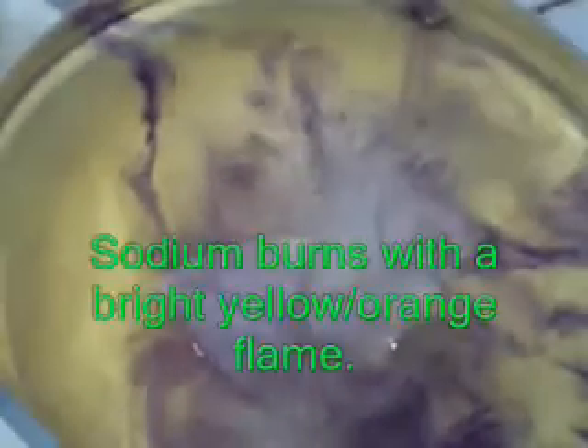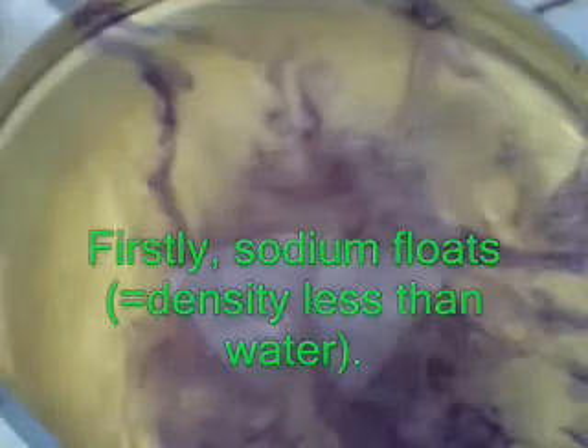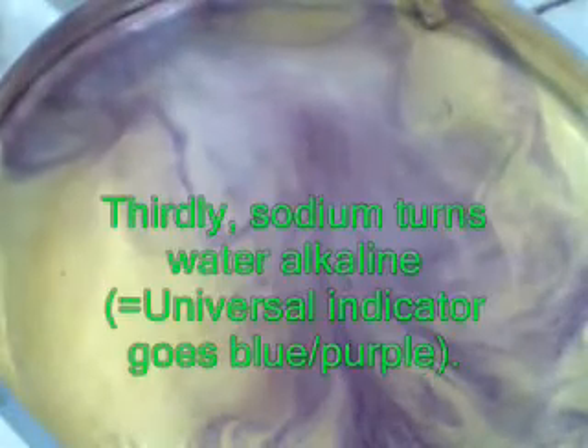Now isn't that nice? I hope there are no smoke detectors in here, otherwise I'm going to be responsible for setting off the detectors again. And that's the end bit of the sodium just there — it just exploded a little bit. We could see that lovely sodium color as it was burning.